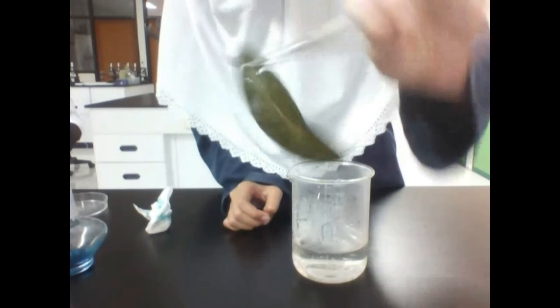This is the result of the boiled leaves and the boiled water. The leaf will turn its color into brown, and it seems that it's sufficiently boiled. Now we have to prepare for the extracting process for the chlorophyll.